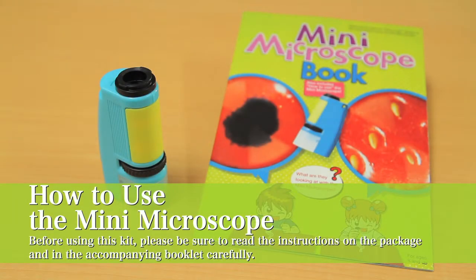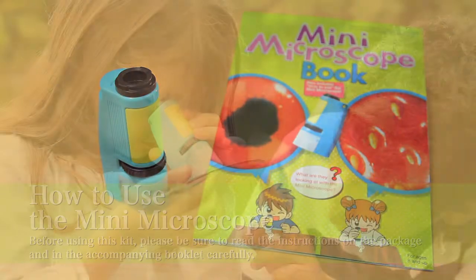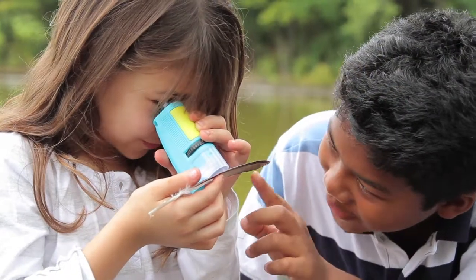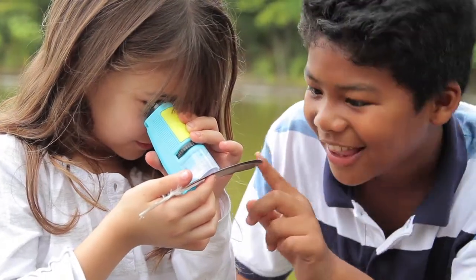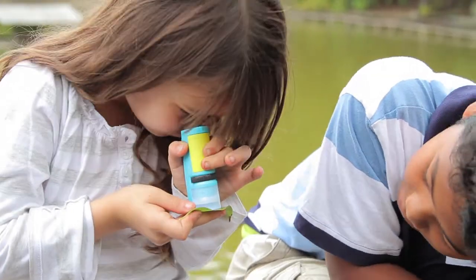How to use the Mini Microscope. Use the Mini Microscope to explore the world that surrounds you and the mysteries of plants and insects.